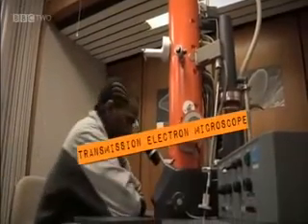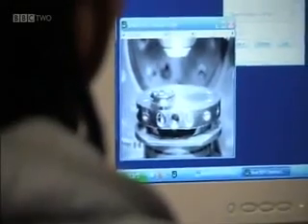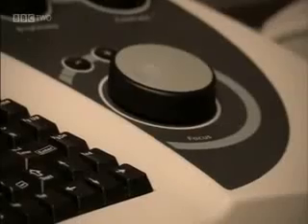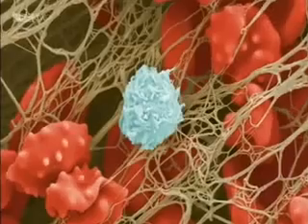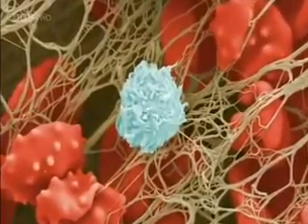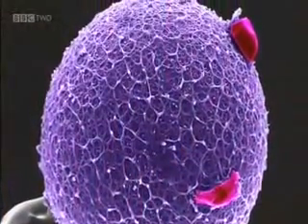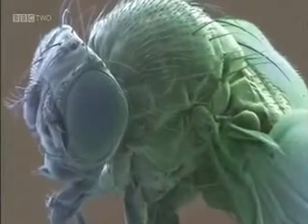There are two types of electron microscope: the transmission and the scanning. The scanning electron microscope scatters electrons across the surface of a specimen and can magnify in incredible detail. Here is a leaf surface under a scanning electron microscope. Both types of electron microscopes make black and white images, but these have been colourised to make them clearer and a lot more appealing to the eye. Check out this fruit fly.